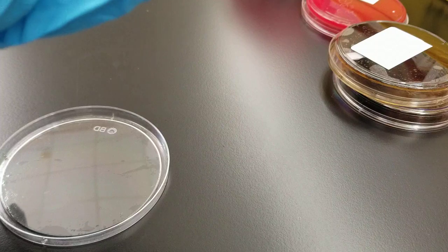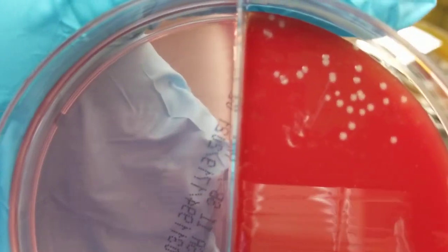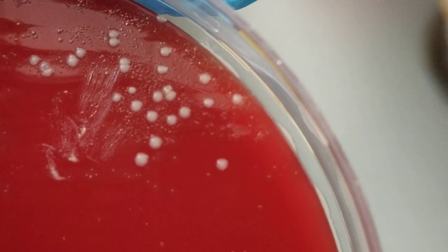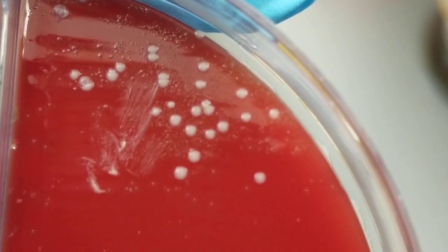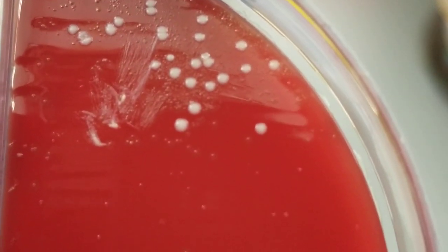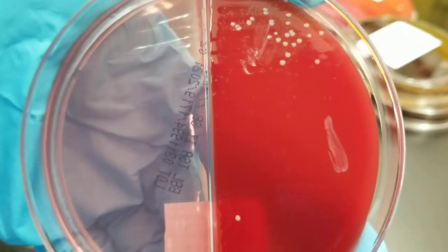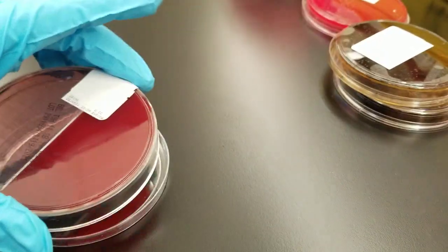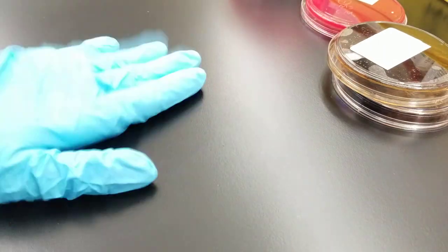This one is pretty much the same type of thing. Let's zoom in — look at all those little tiny pinprick colonies. There are at least two different types of organisms here. You can tell that they did take from this plate just to see what the growth was and check if it was pathogenic, but it shouldn't have been.